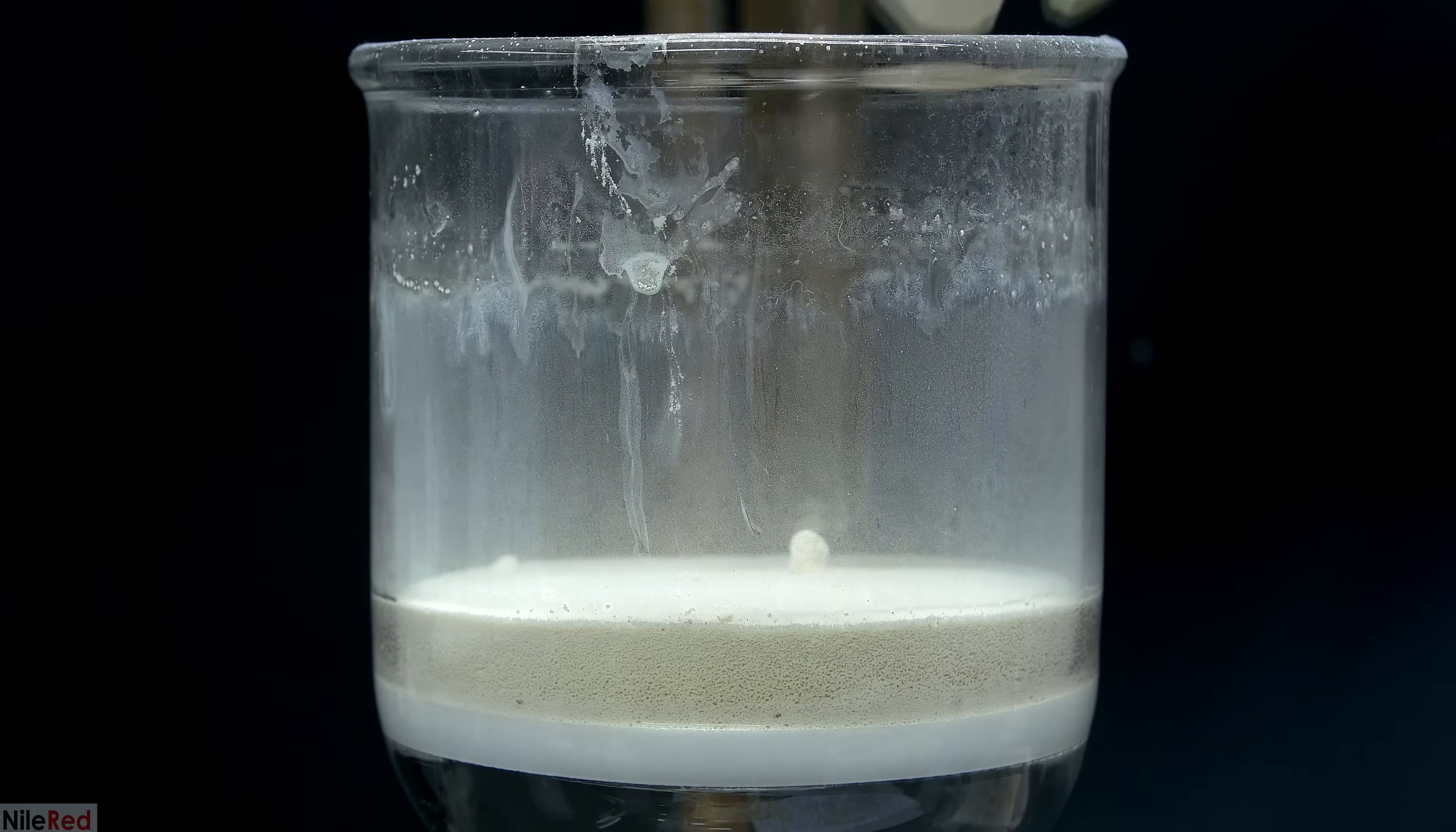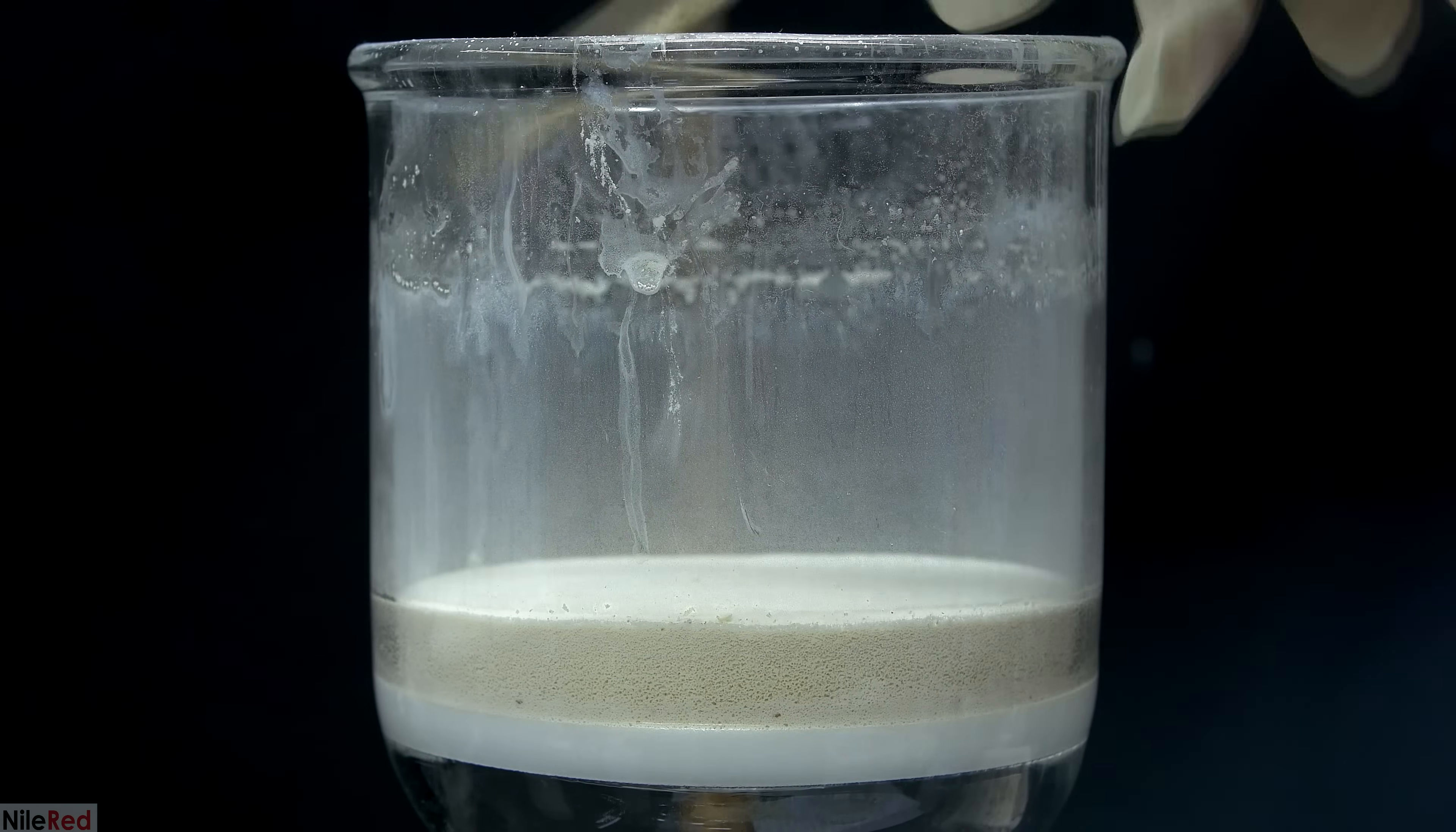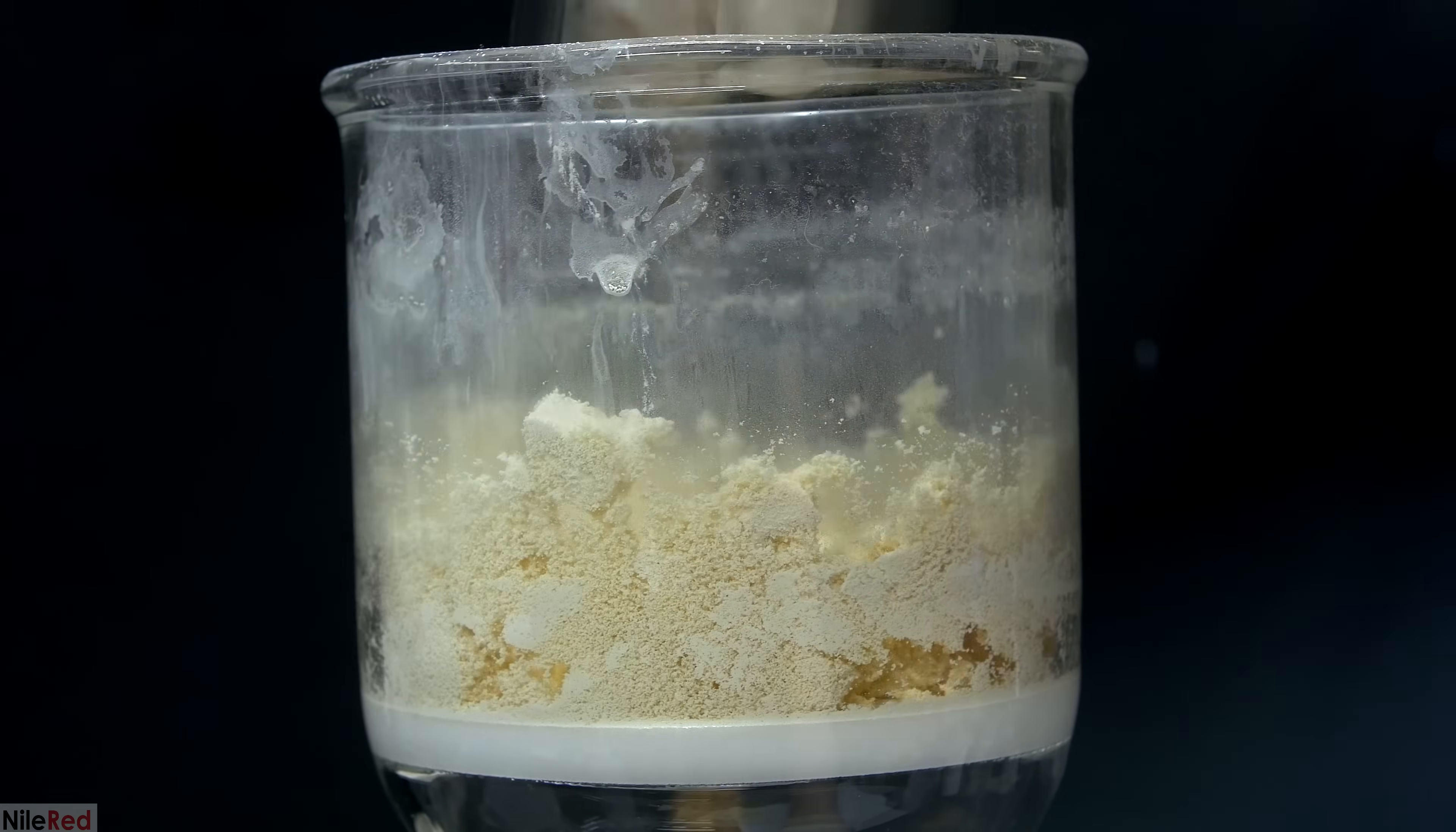On top of the hydroperoxide, we actually have a few chunks of lithium hydroxide that didn't react. So, using a spatula, I quickly get rid of them. The hydroperoxide in the filter is then broken up using a glass stir rod.